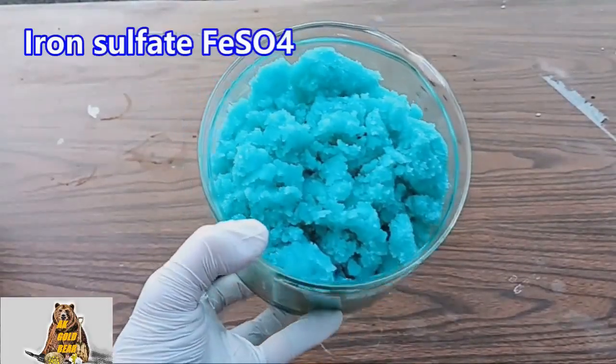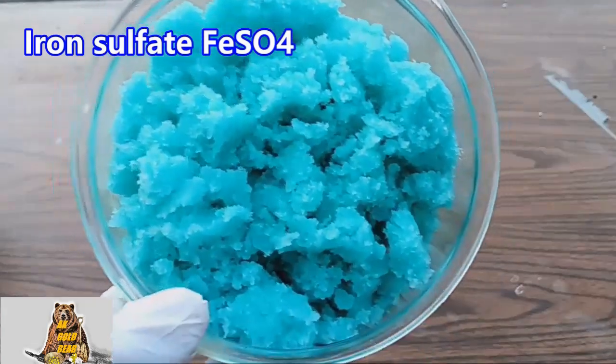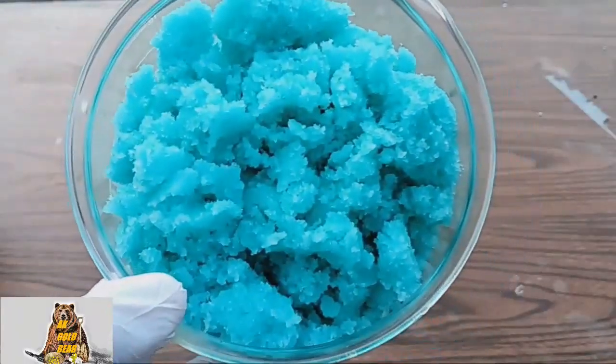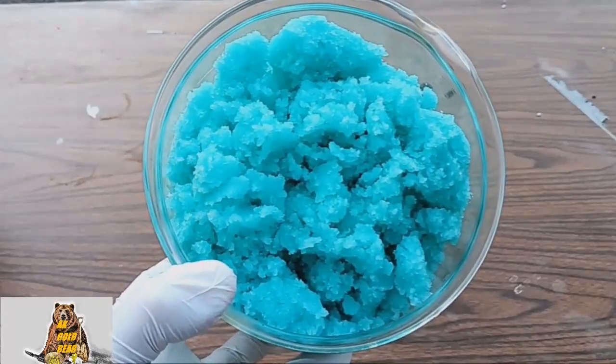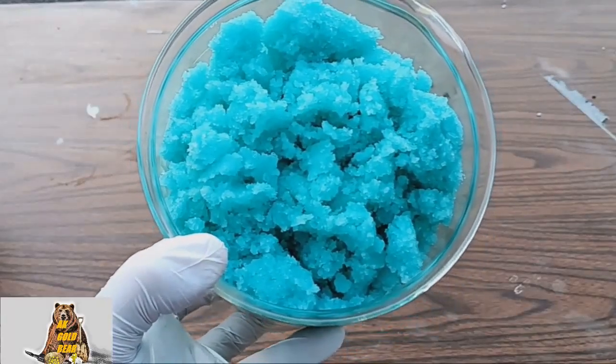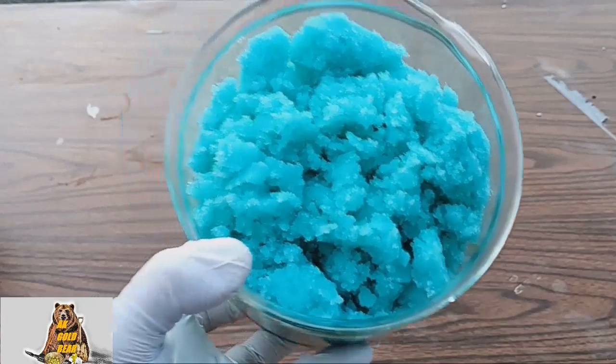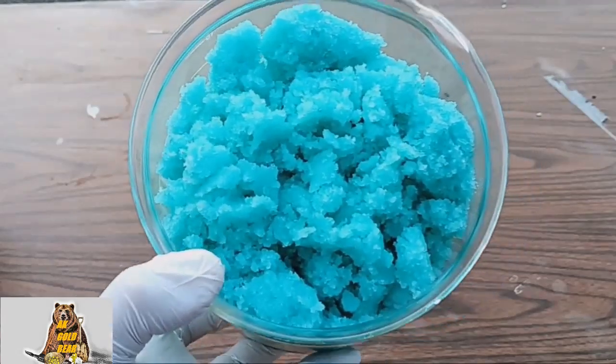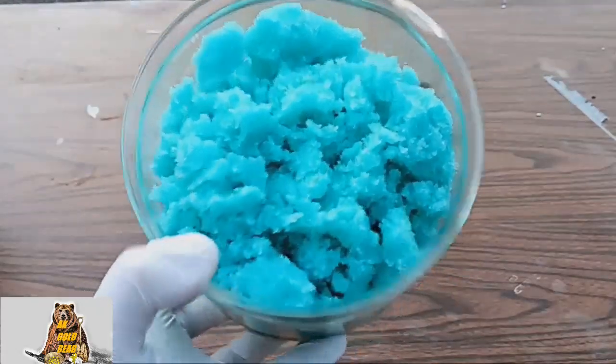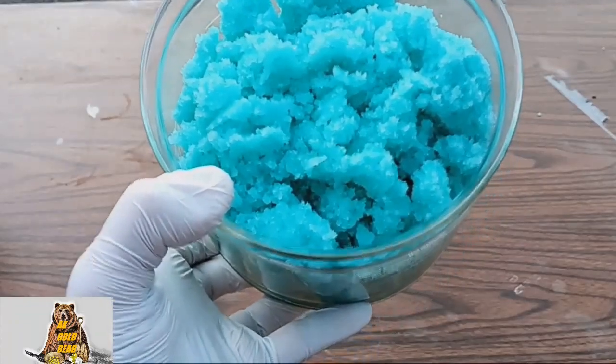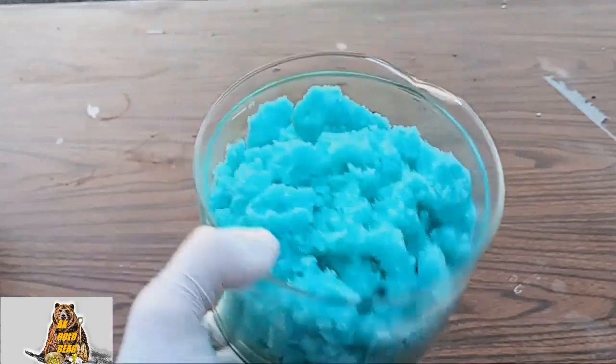Okay ready, this is how I'm making the purest iron sulfate for the gold or palladium precipitation. I love working this ferrous sulfate. Precipitation of gold is fast and after precipitation gold sediment looks like small granules not like a dust, not like after sodium metabisulfite. And one more very important part, sodium metabisulfite is very toxic. Ferrous sulfate is completely non-toxic. When I use iron sulfate my brain is fine and my lungs are okay too. It's very important.